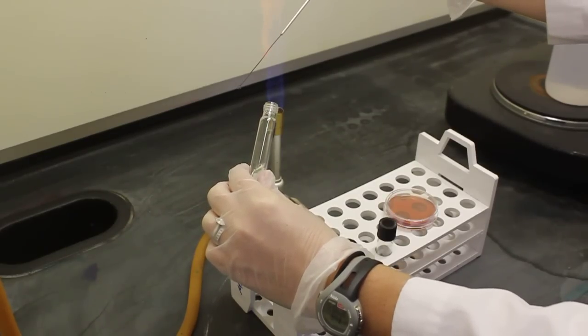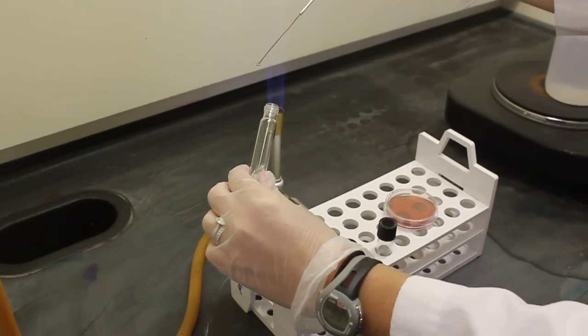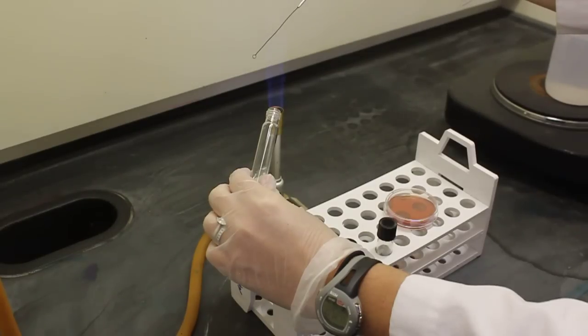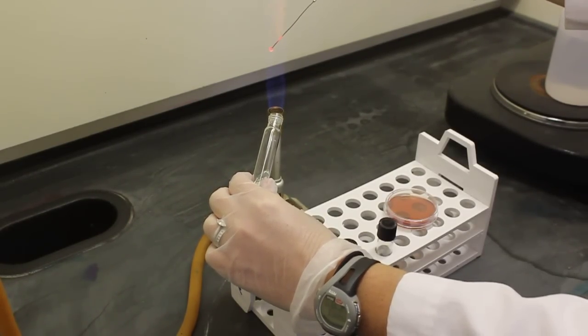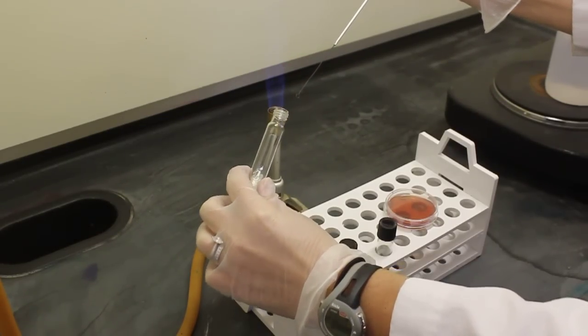It is important now that I have this tube containing bacteria open that I keep it near the flame. You do not want to leave an open tube of bacteria too far away from the flame. You do not want bacteria to get out of your tube or bacteria to get into your tube from the air.